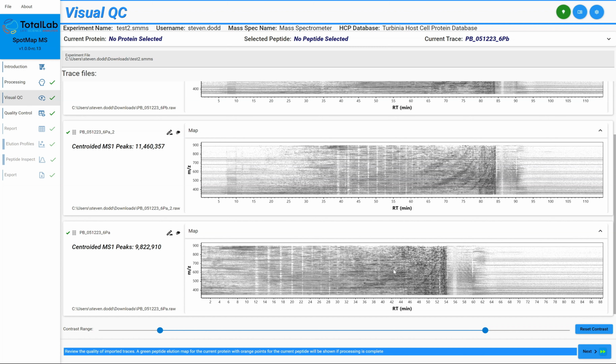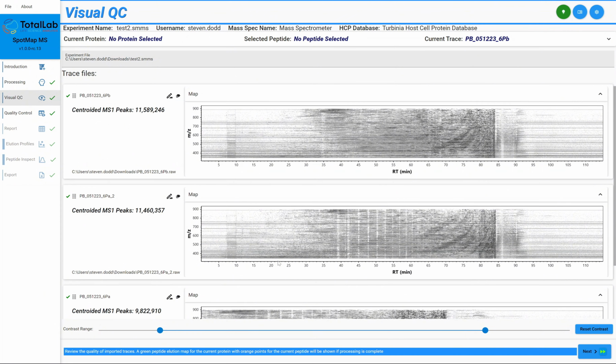When we were speaking to the people that performed this work for us and showed them this, they said that with the software they were currently using, they never would have seen this. What they would have done is go through the whole experiment, analyze it, get their data processed and say, why are the results so different for this replicate? However, using SpotMap MS, they're now able to see that information straight away and say, we should run the sample again and discount this trace, and not waste all of that time processing it and trying to work back from an erroneous result. They can see that straight away, so it saves them a huge amount of time, or it would have saved them a huge amount of time if they were using SpotMap MS.